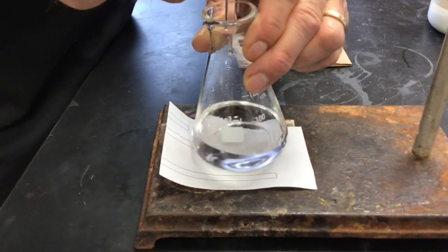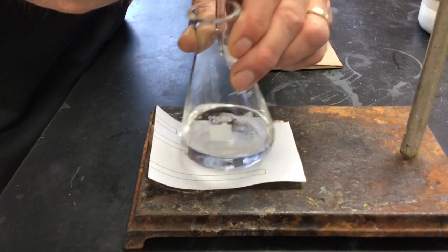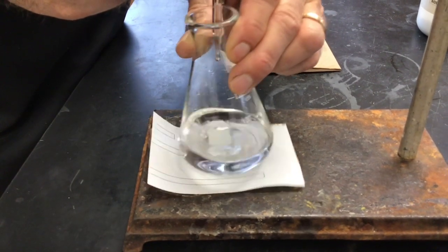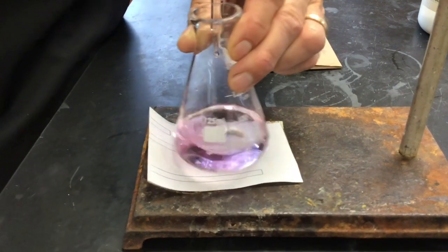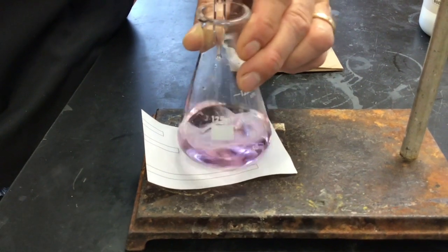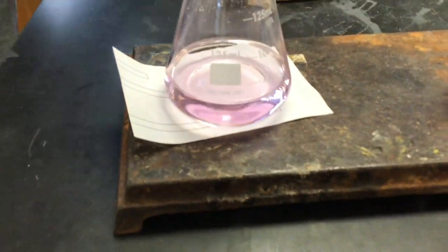Yeah, you're fine. Is that it? I think so. I put in one more drop. Okay, so that should be it. Ah, okay. That's a better endpoint this time.